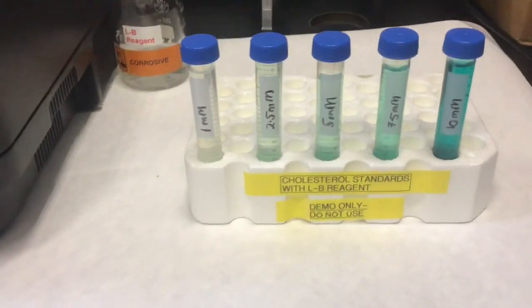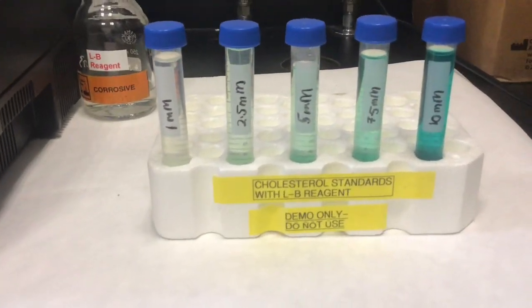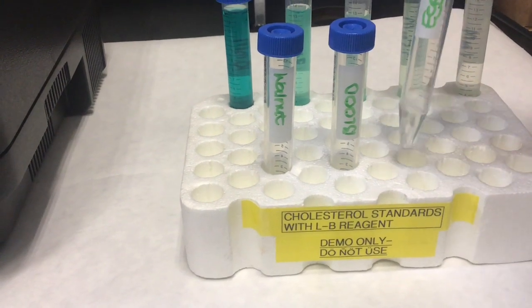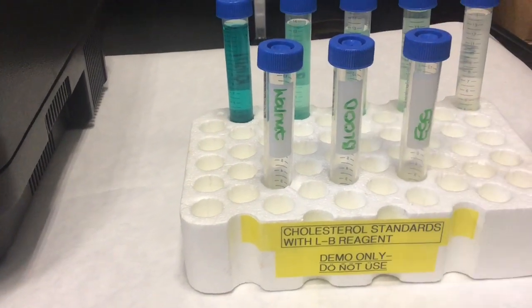Liebermann-Burchard is a reagent used in colorimetric testing to detect cholesterol, which gives a deep green color. One milliliter of egg, walnut, and blood sample was used for the testing.